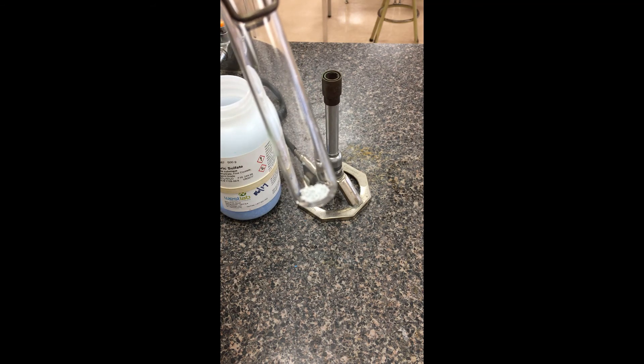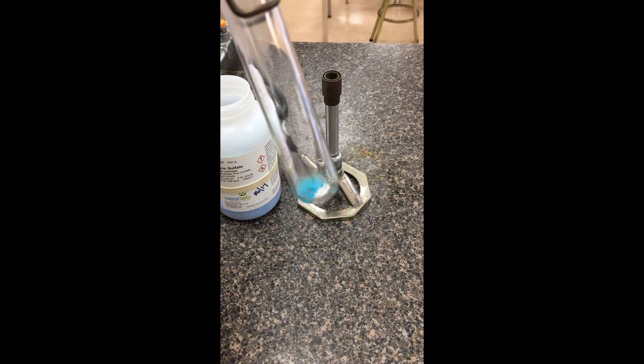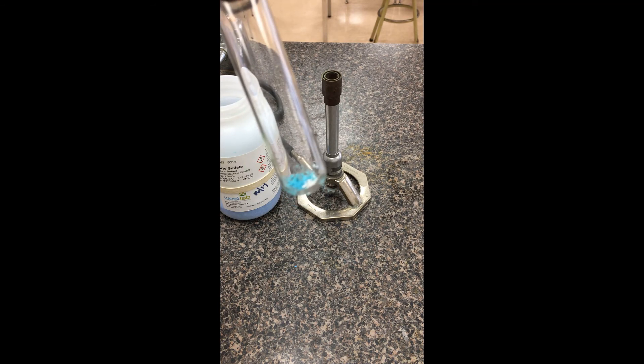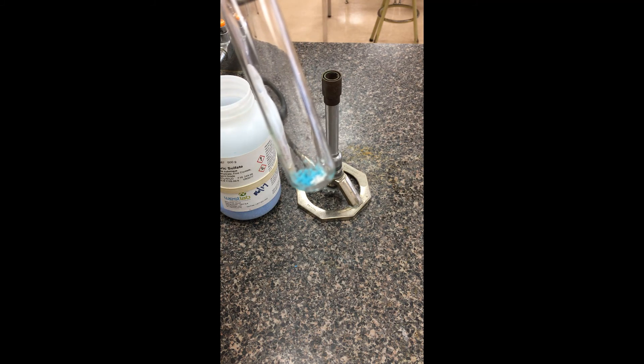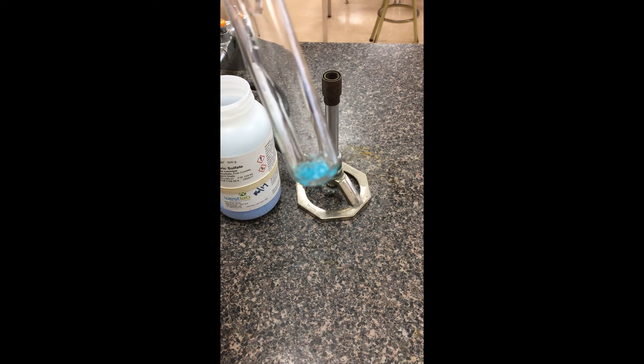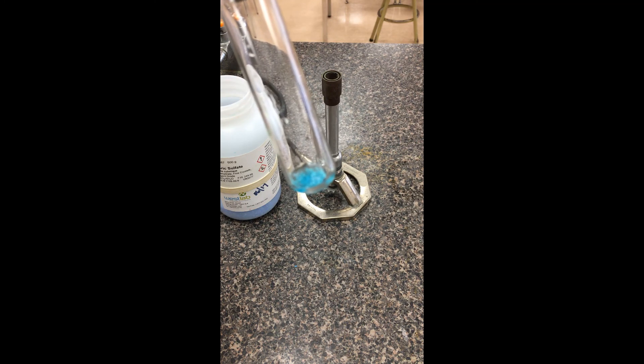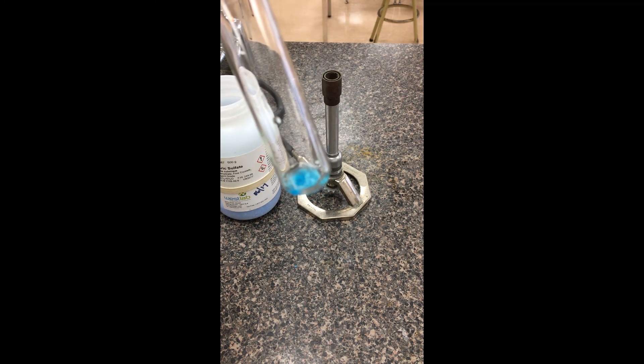I'm just going to add a little bit of water. So, hopefully you can see what happens to the powder. Okay. Thanks, guys.